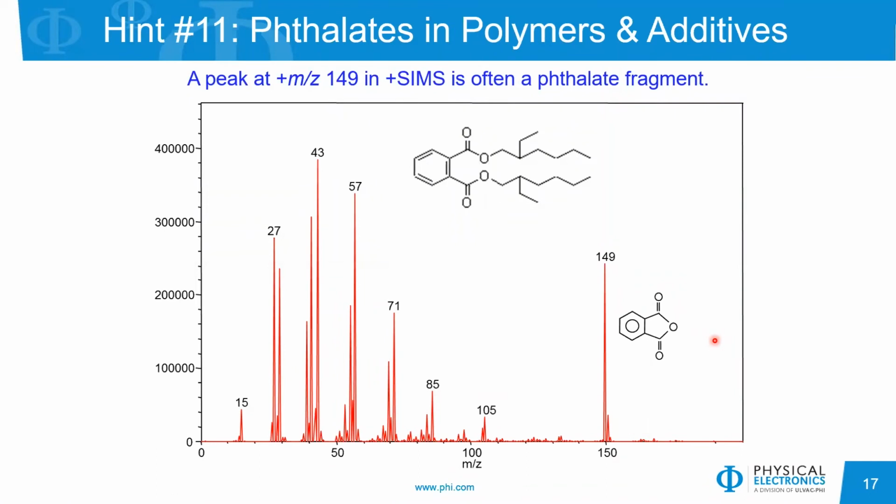Phthalates and polymers and additives will almost always produce a secondary ion at a mass to charge ratio of 149 in the positive ion polarity. And this peak has this structure. So phthalates will almost always give a positive ion peak at a mass to charge ratio of 149.